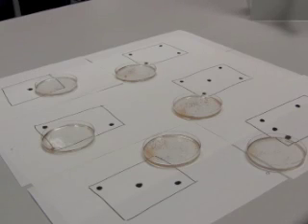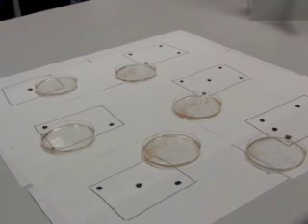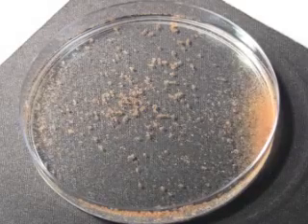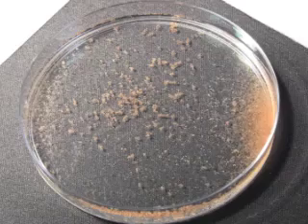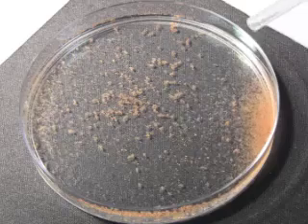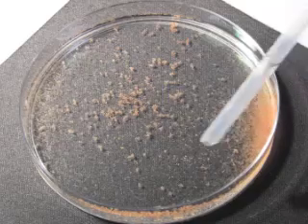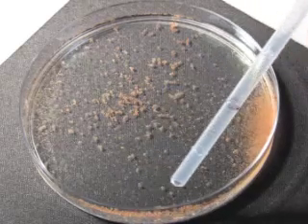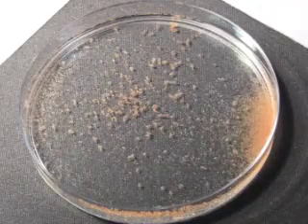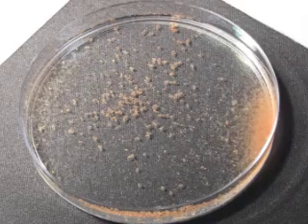After choosing your treatment group, you will carefully collect one milliliter of organisms. The next point to take note of is that Artemia tend to clump together — they like hanging out with their friends. What you can see here is a whole bunch of Artemia swarming together, and you'll also notice there's not many live Artemia around certain areas. You need to get a representative group of live and dead Artemia from this SLS concentration.